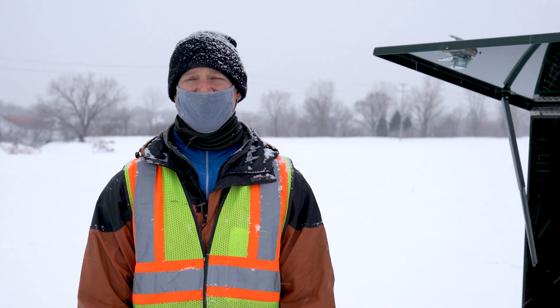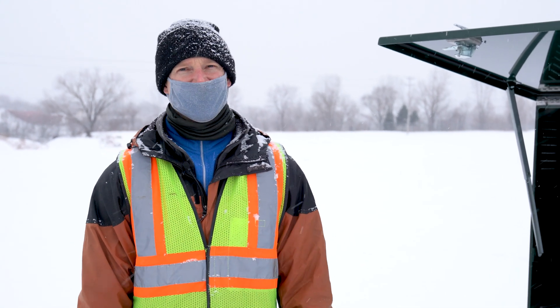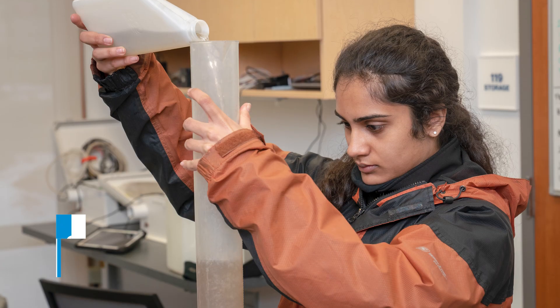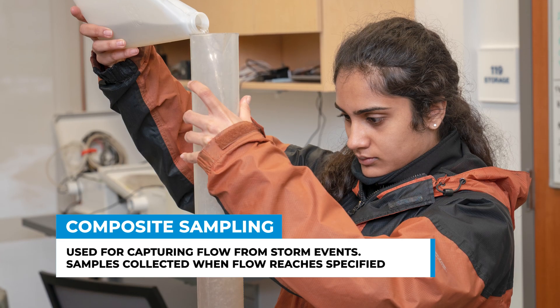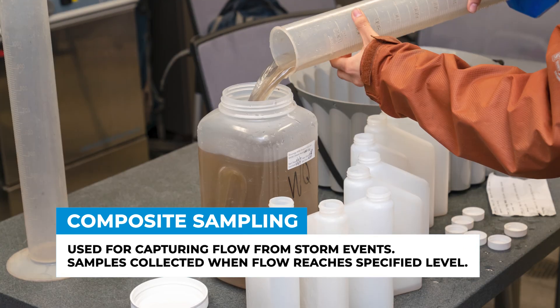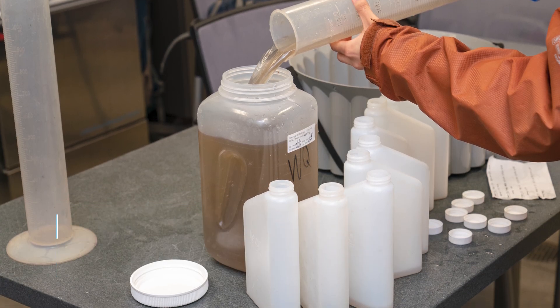When we've had an event like a rainfall or a warm day that melts a lot of snow, we can program these automated samplers to collect one bottle per 10,000 gallons. So if we've got an event sample, we come here and collect the bottles from the sampler.